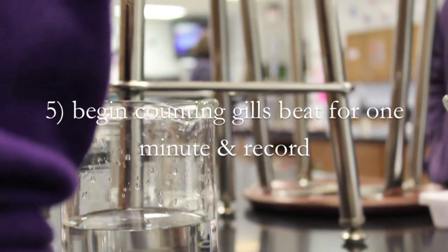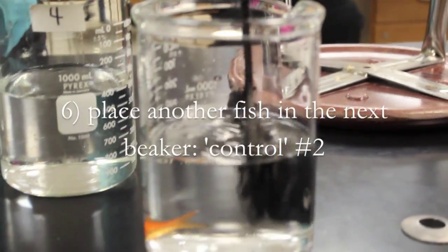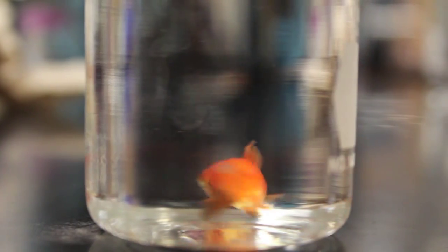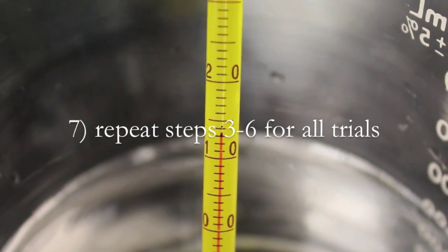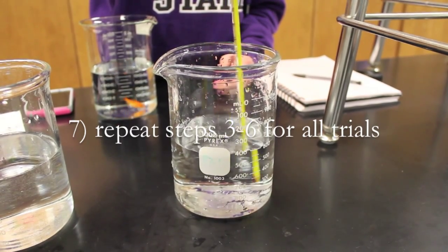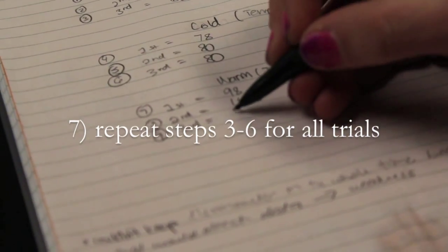After recording the first fish's metabolic rate, place a different fish in the beaker labeled as control with the number 2. This will be your second trial for the controlled group. Each group, normal, warmer, and colder beakers, will have 3 different trials. Repeat steps 3 to 6 for all trials. Don't forget to change the water's temperature in accordance with the labels on the beaker, and make sure to use a different fish for each beaker, thus accounting for a total of 9 goldfishes in this experiment.